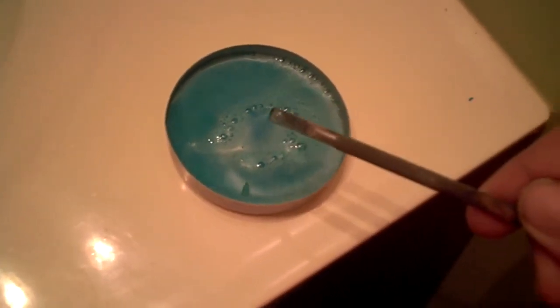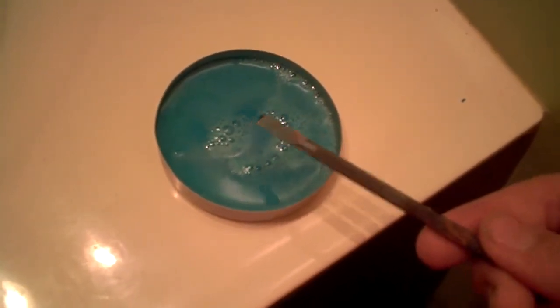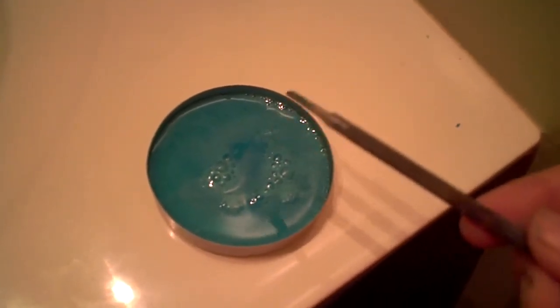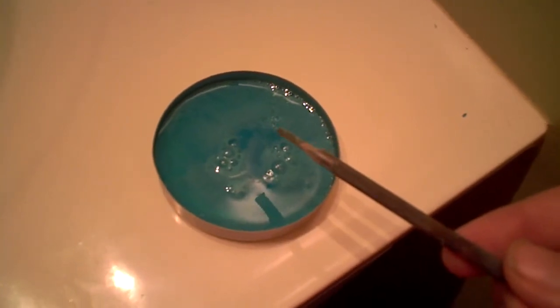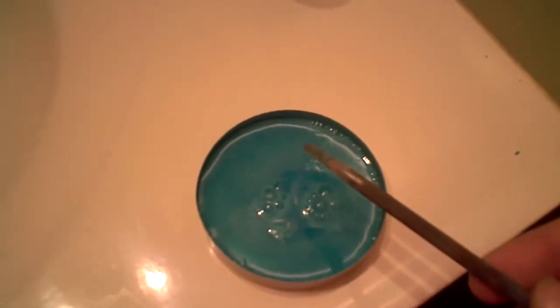I'll keep on scooping sodium bicarbonate in here until it stops bubbling, and maybe add a little bit more copper sulfate to make sure there's no extra sodium impurities that we don't need to have.